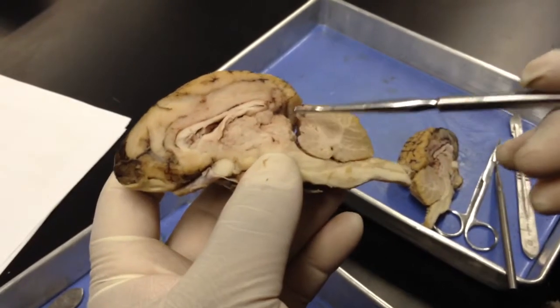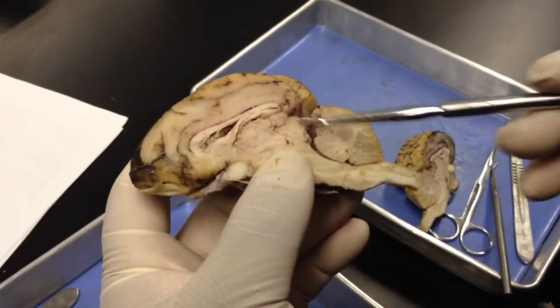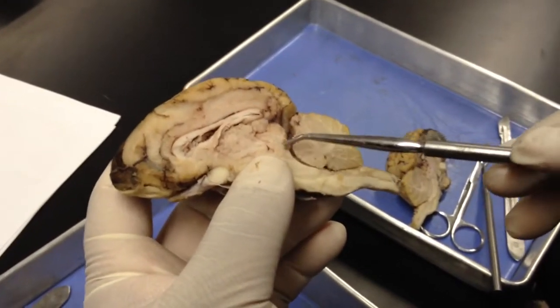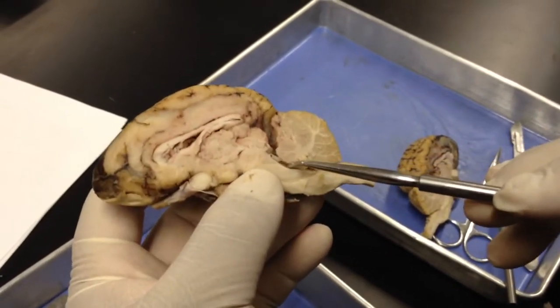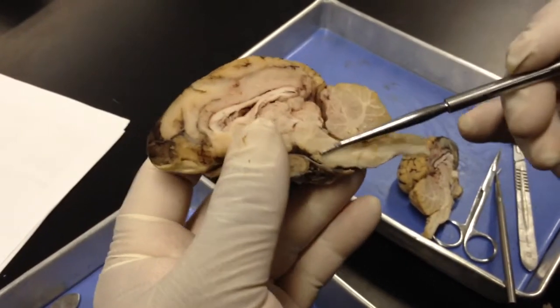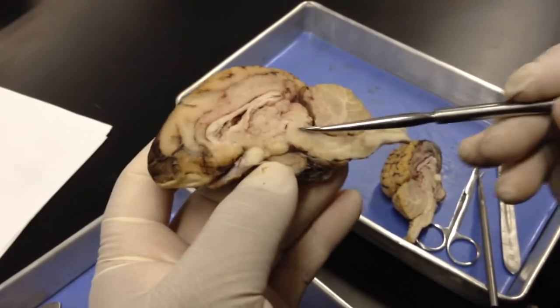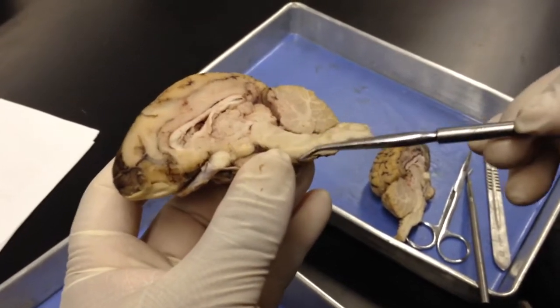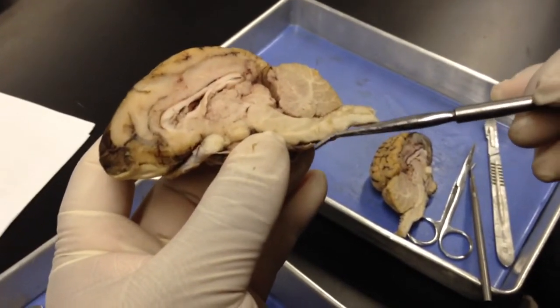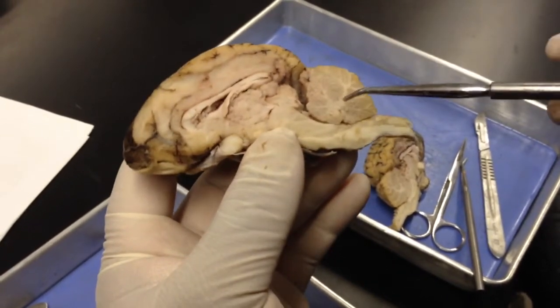Remember, these are the ones that are involved, the superior colliculi with moving the head in the direction of the eyes, and the inferior colliculi with reflexive movements of the head based on what you're hearing. As you make your way down, the midbrain would be here. This is where you would find the cerebral peduncles. You continue down from the midbrain to the pons, and then to the medulla, and then eventually you see the spinal cord. Here's the cerebellum.